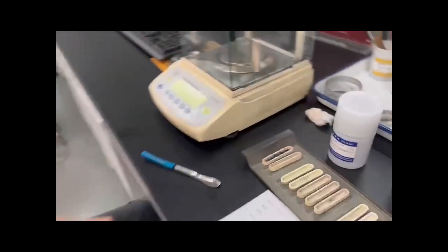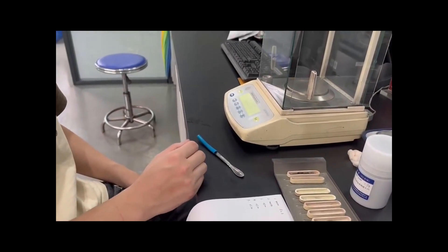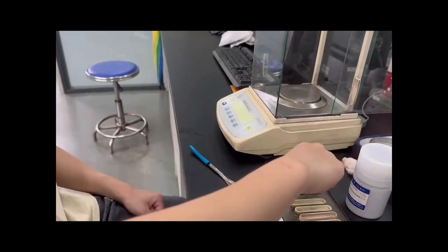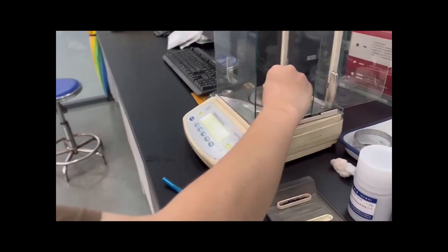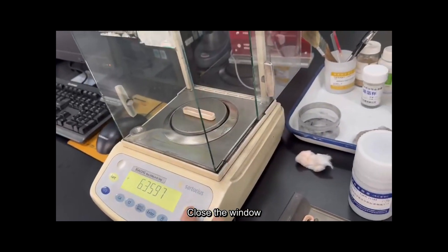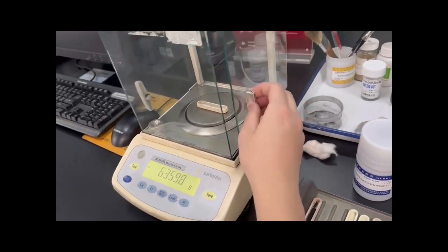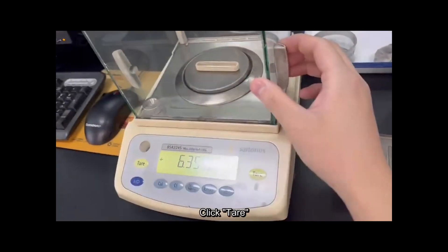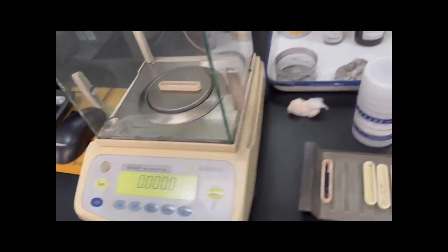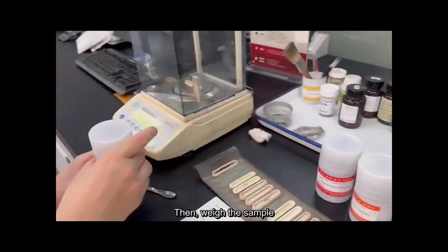First, put the crucible on the balance, close the window, click Tare, then weigh the sample.